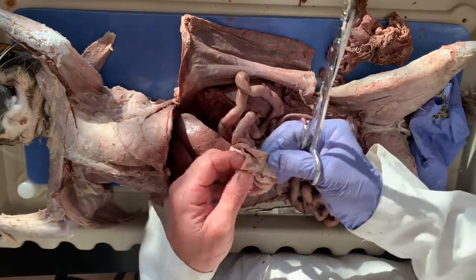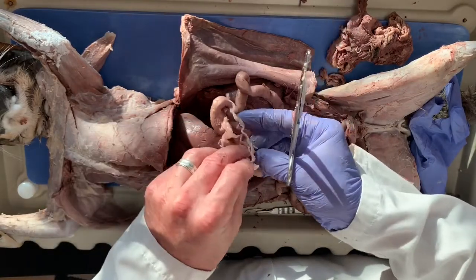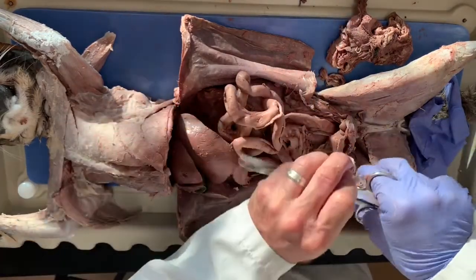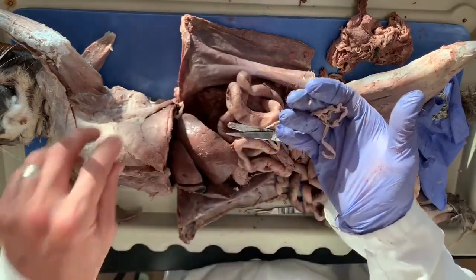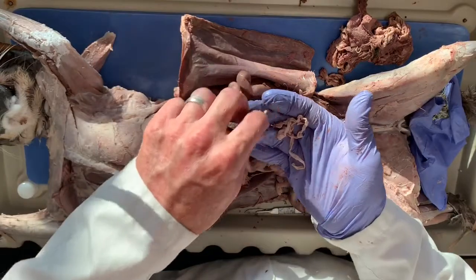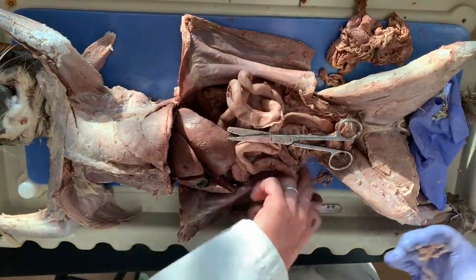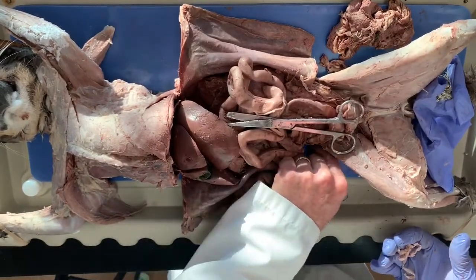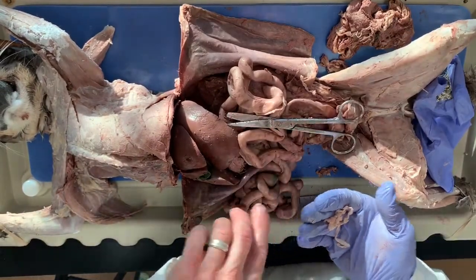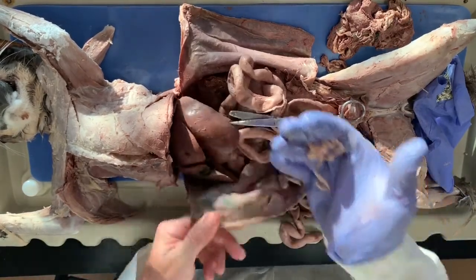And that looks like the end of it right there. So let's pull this out. I know I'm touching it with my bare hands. So that is a tapeworm. And then, where'd that roundworm go? There's a tiny little segment of the roundworm. I'll find the rest of it here somewhere.